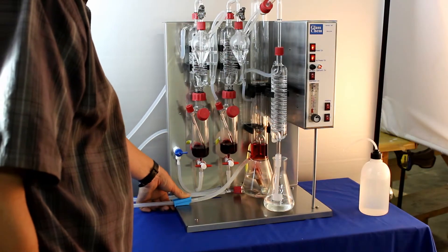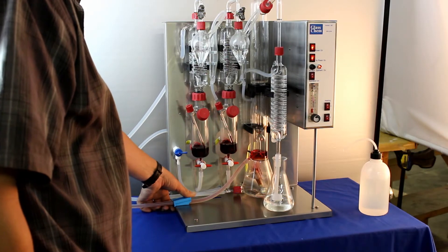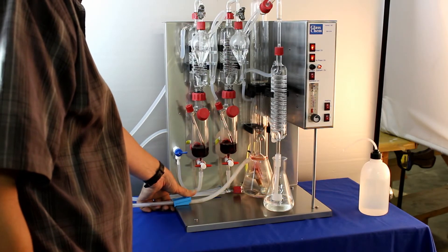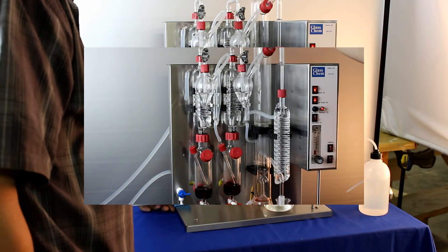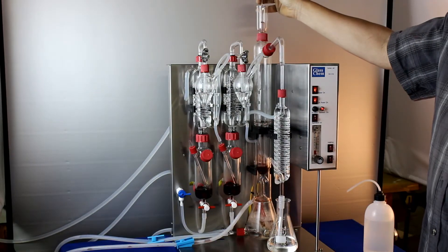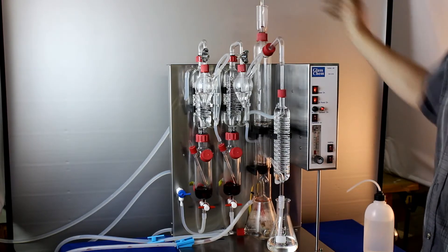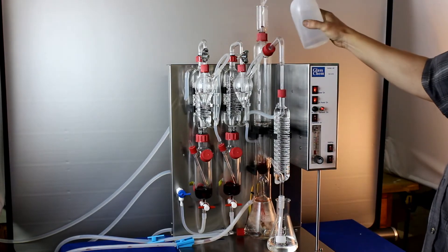Drain the waste wine by opening the blue bench valve. While the boiler is busy boiling add the next sample and wash again with a small amount of water. Make sure the wine is added while the boiler is busy boiling. Otherwise the wine sample will be sucked back.